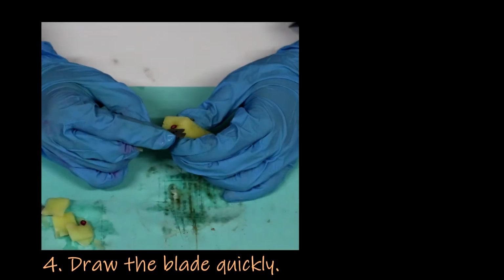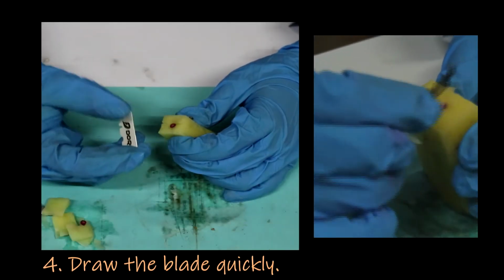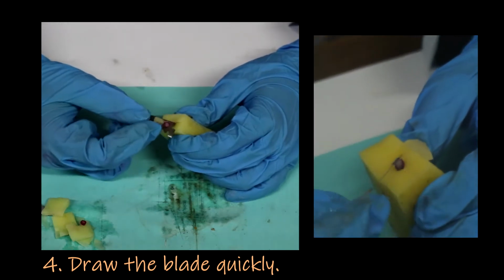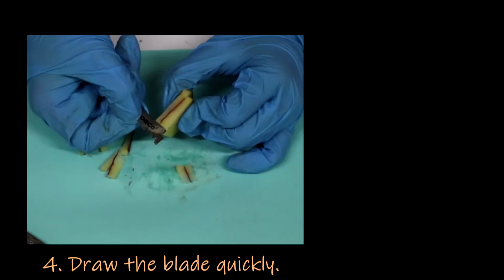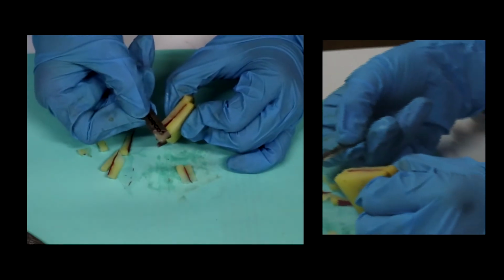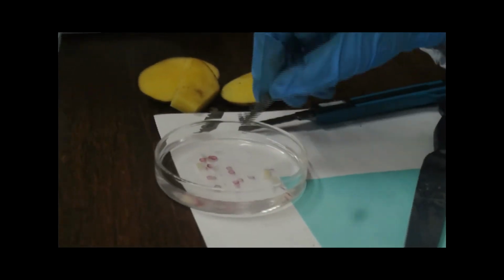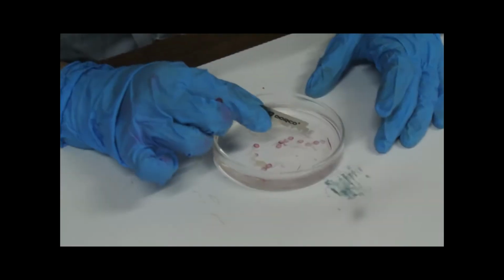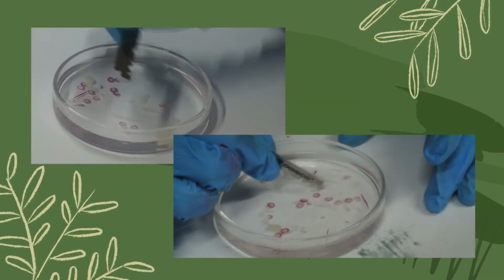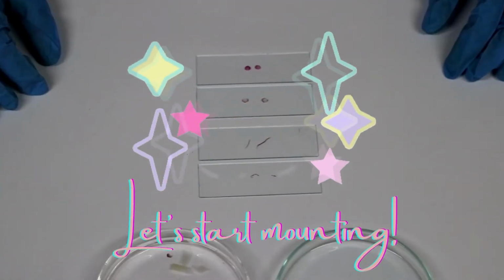Fourth, cut by quickly drawing the blade through the clamp with the specimen. It is important that you do not saw, but slide the blade smoothly and quickly through the material. Thin sections will then stick to the blade and accumulate there. After cutting, dip the blade in a watch glass with water to remove the sections from the blade and, most importantly, prevent dehydration. When you have your choice cuts, we can start mounting.